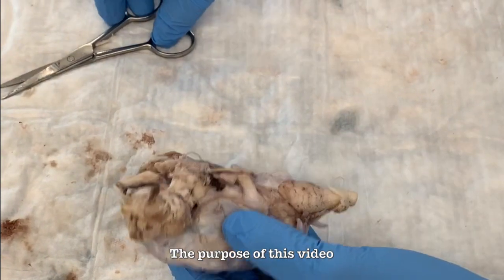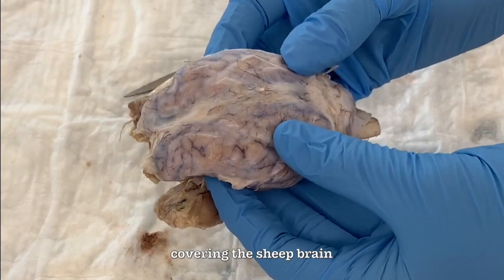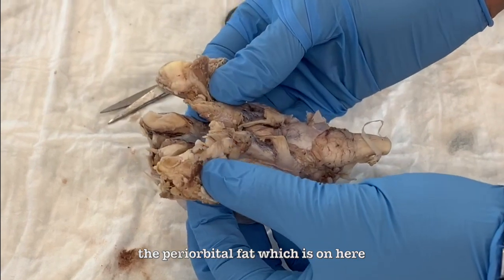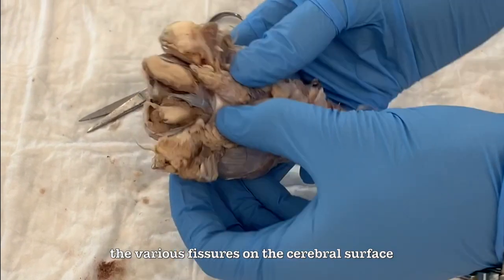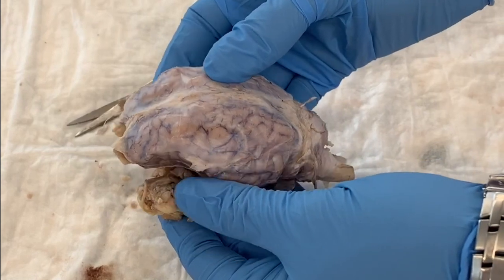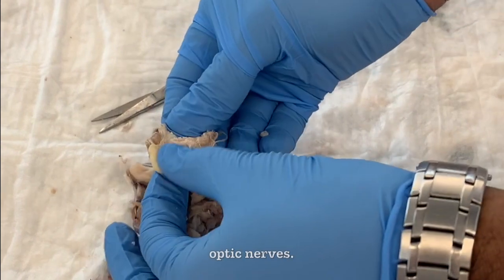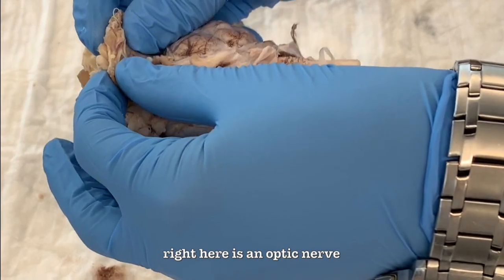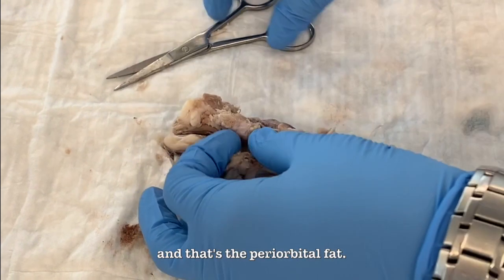So the purpose of this video is to show you how to take off the meninges covering the sheep brain, and also to remove the periorbital fat which is found here. And by doing that, you'll be able to appreciate the various fissures on the cerebral surface and the sulci as well. So we're going to start by trying to identify the optic nerve. So this is an optic nerve. You see right here, it's an optic nerve, and so I'm going to cut the fat which is surrounding it, and that's the periorbital fat.